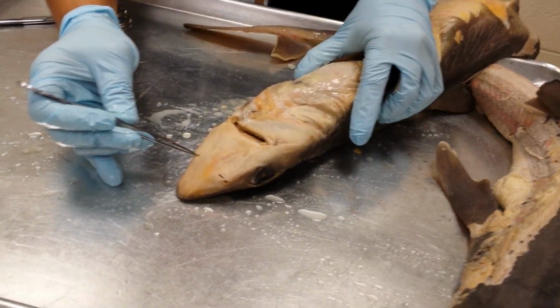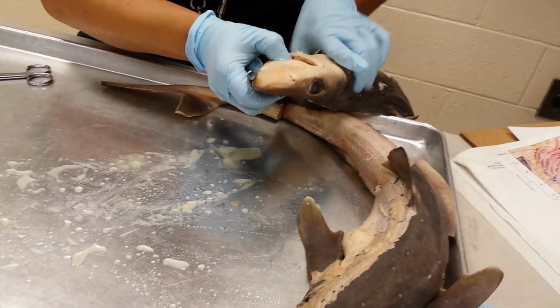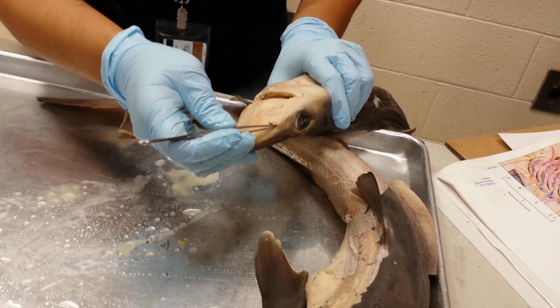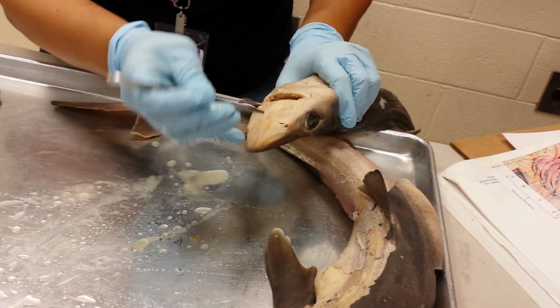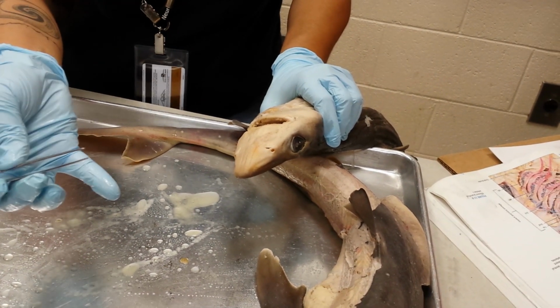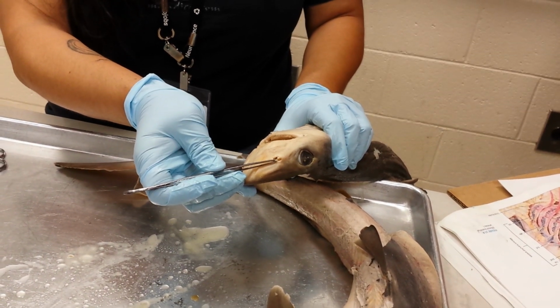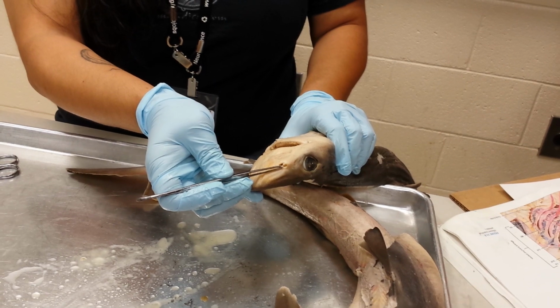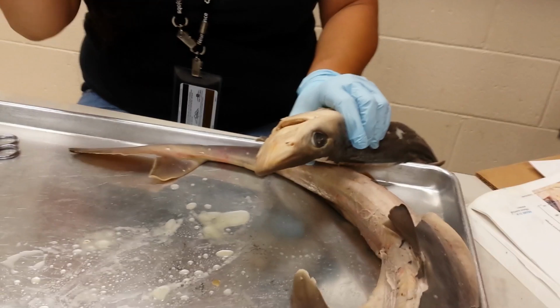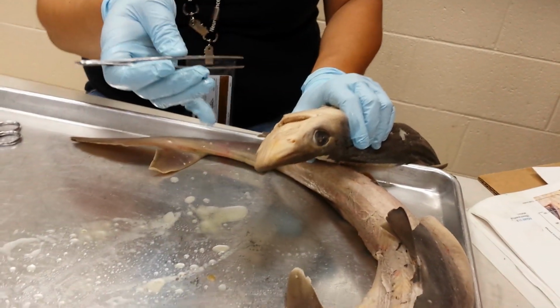It has these big holes on the ventral side. These are the nostrils. Gross. The nostrils have in the front a small hole that's called the incurrent aperture, and a larger hole that's the excurrent aperture. It's kind of the same chamber. There's a little flap right here called the nasal flap. I really think that's what it is. It separates the incurrent from the excurrent aperture.